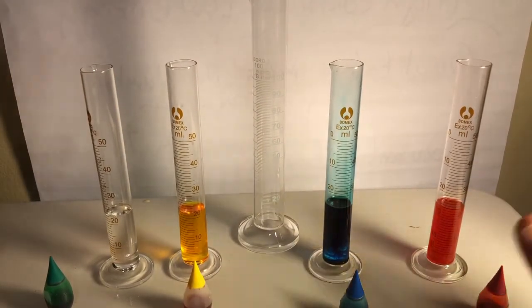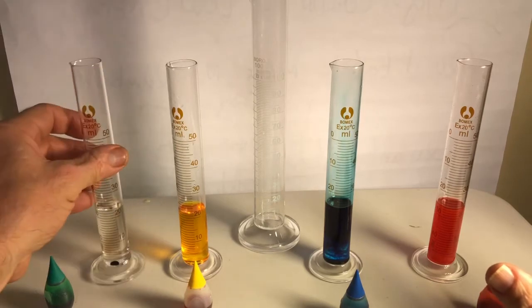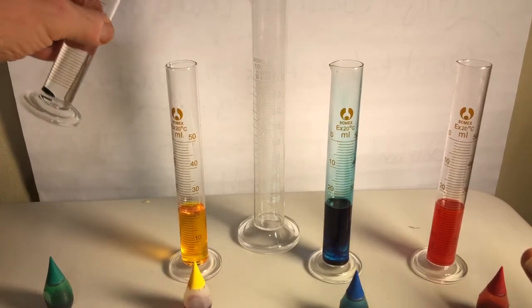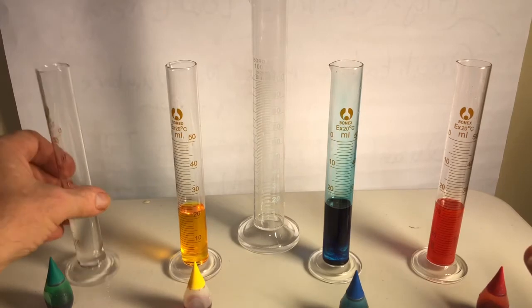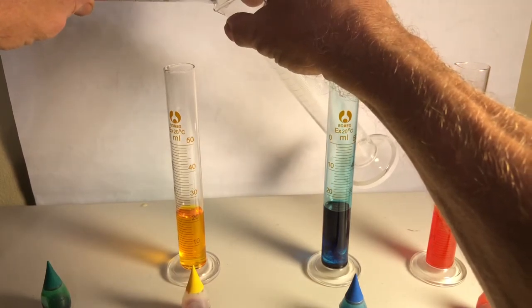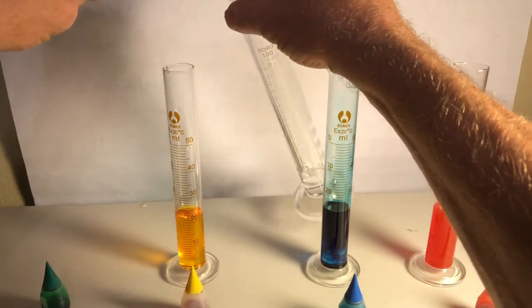What's going to happen? Well, first of all, this was interesting. I put that little drop in there, and that's what happened. A drop of food coloring. That's crazy. It's supposed to be the green one. So what I'm going to do is I'm going to pour these ever so carefully. Actually, yeah, I'll just go in order. And we're going to find out what they are. We're going to find out how they stack up. What color are you going to get when you mix all these together? What you think? All right, I'm going to keep the blob out of there.